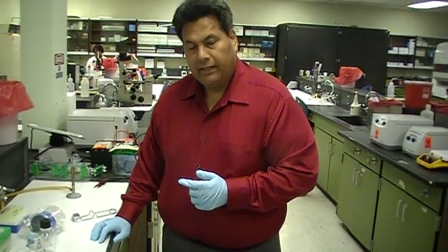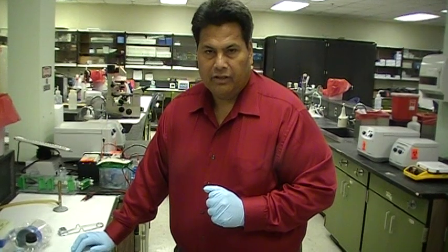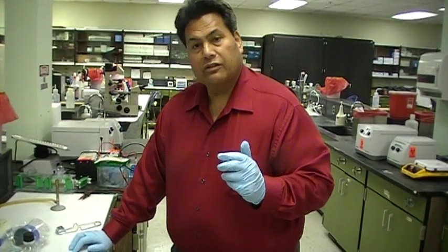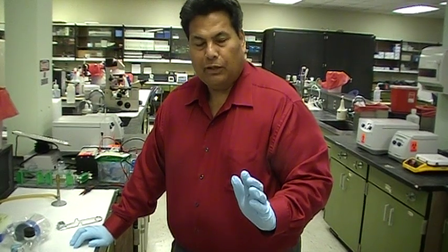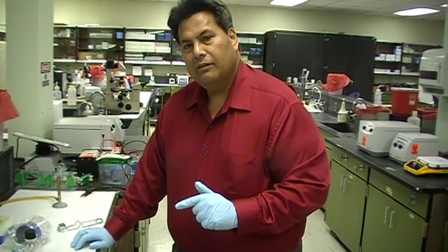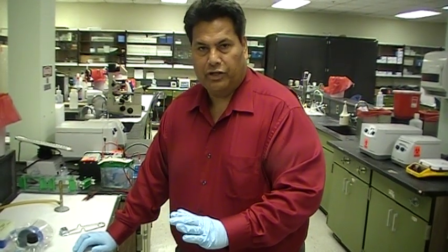Now, I can tell you that not every solution can be autoclaved. And so the ones that you can sterilize by autoclaving, by all means, autoclave. The ones that you can only sterilize by filtration, then by all means, use the filtration.